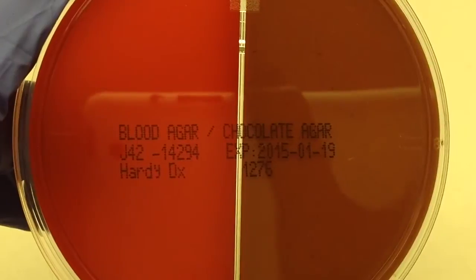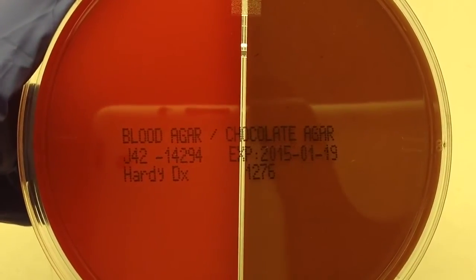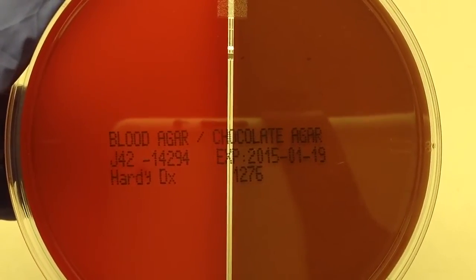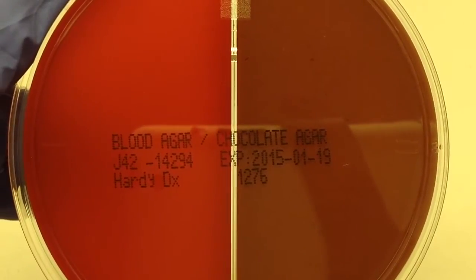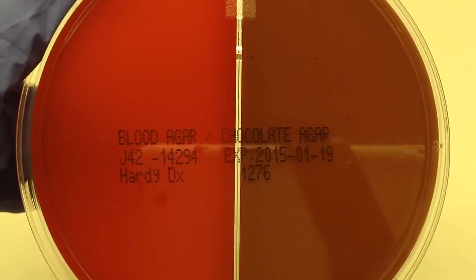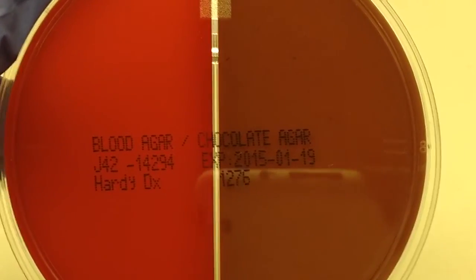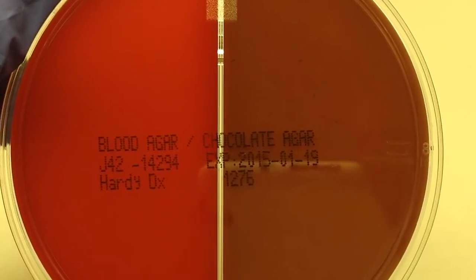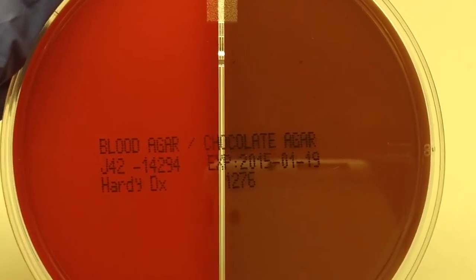Our next plate is a bi-plate. It's half sheep blood agar, just the same as we looked at, and the other half is chocolate agar. Now chocolate agar is an enriched media, meaning that certain organisms, specifically members of Haemophilus — Haemophilus influenzae — need it in order to grow.